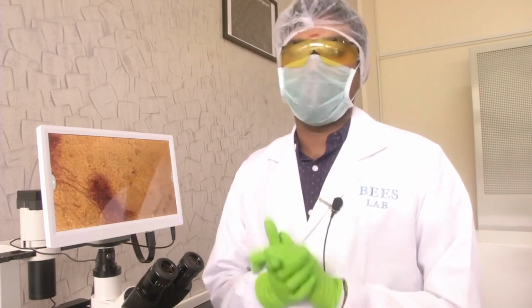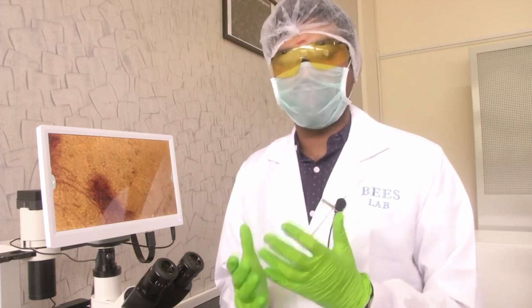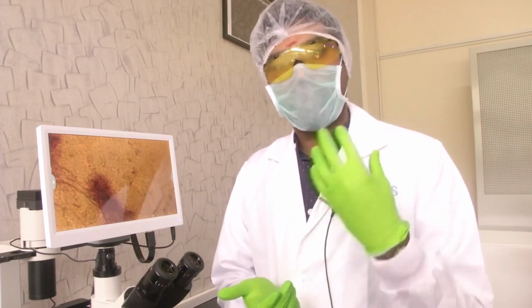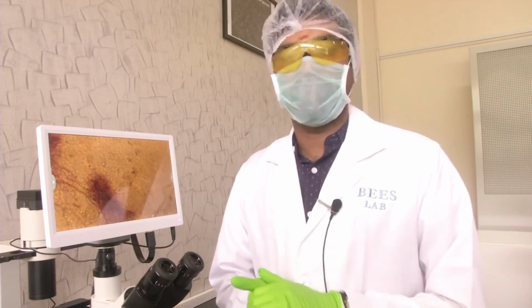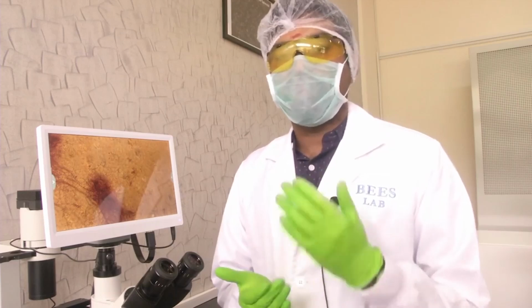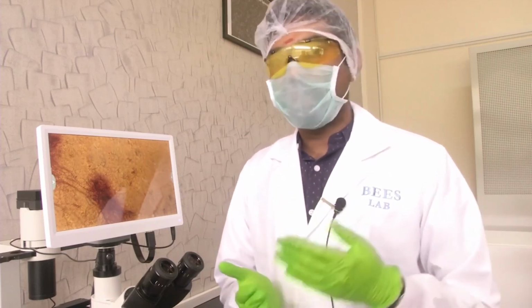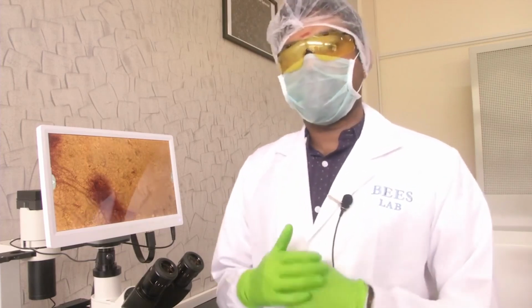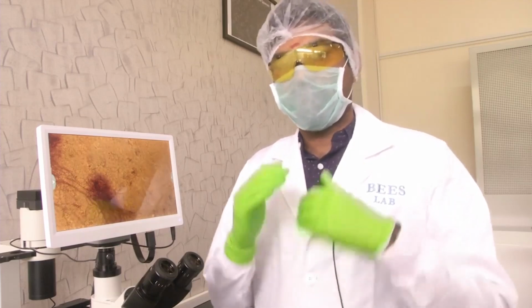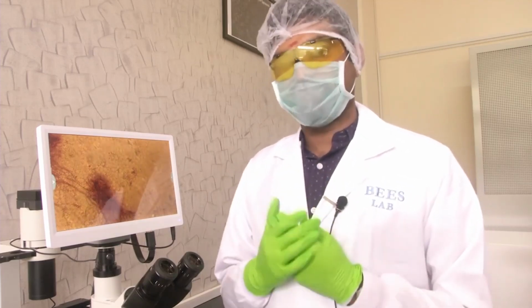Then we went on to see the principles of optical microscopy, and first we saw the 3D stereo microscope, understood its working, what exactly it is used for, and how to operate it, and we saw a few samples with the 3D stereo microscope. Then we went on to see the metallurgical microscope, what are the different types of illuminations available, and we saw a few samples with it. So today we will be seeing the next type of microscope that we were continuously talking to you about, which is the inverted microscope.